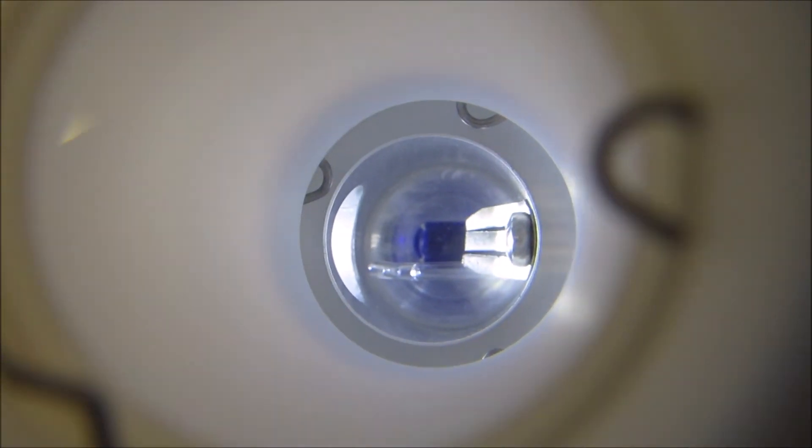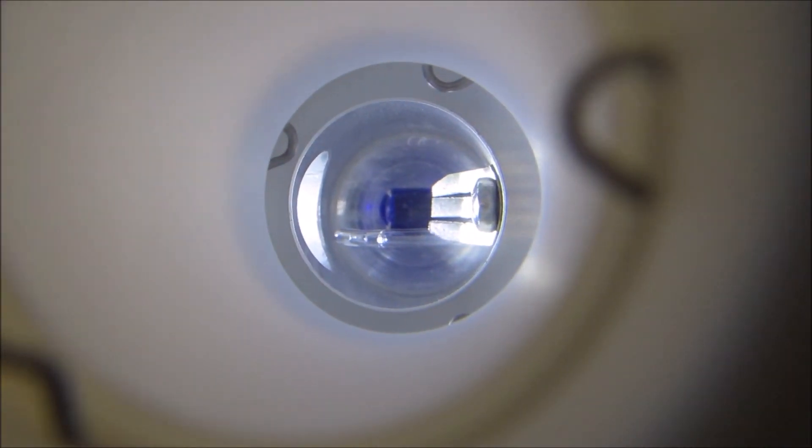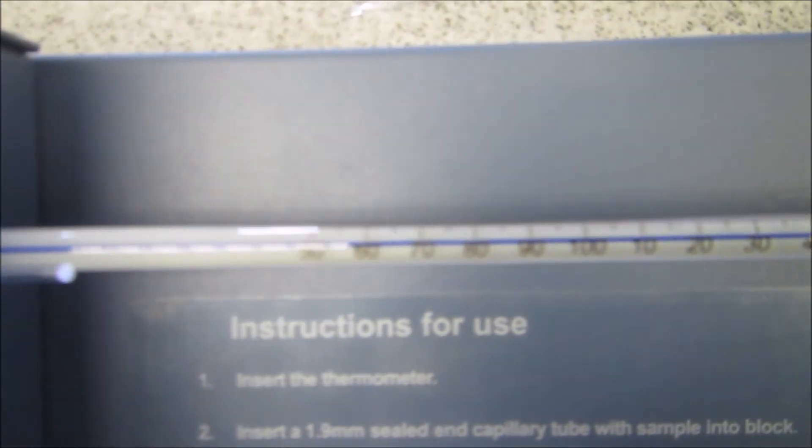This is the second one. And at that point, you can see now all the white crystals have gone. I'll just show you the thermometer again.